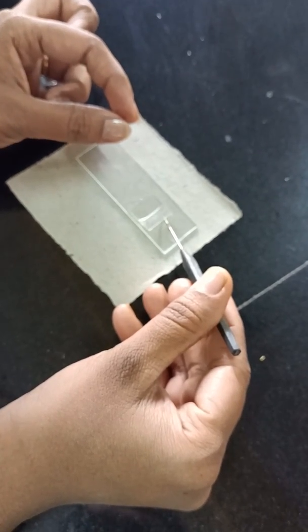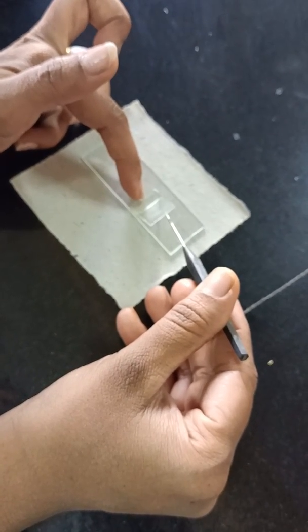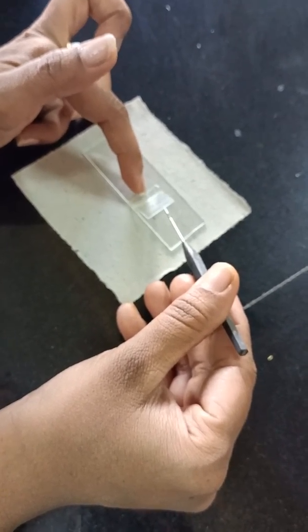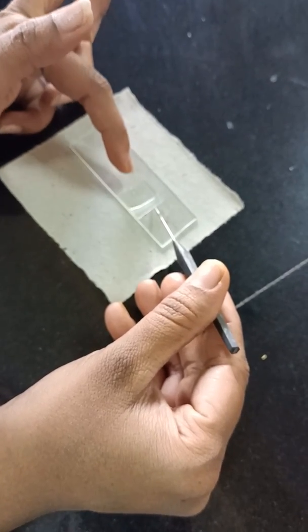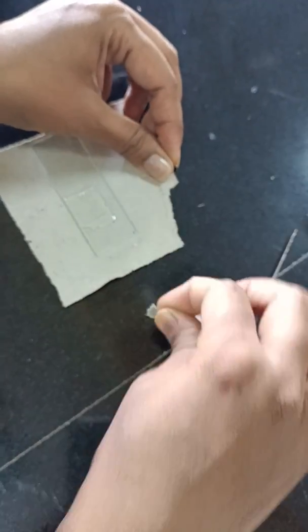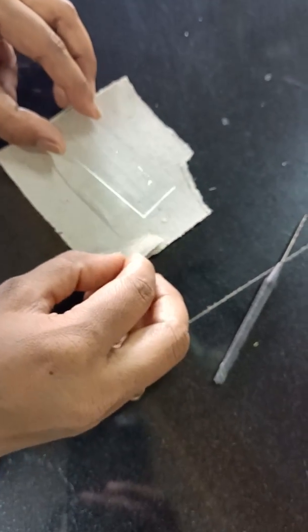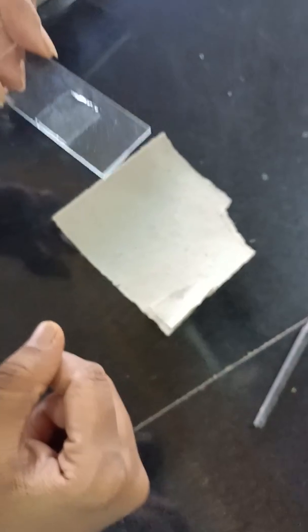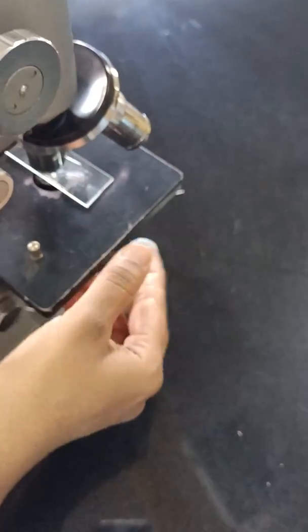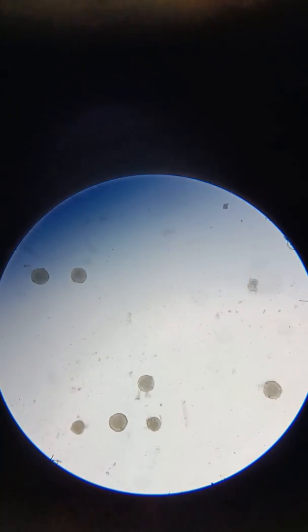Now see how I am putting the cover slip — I am just using a needle. At one end I am holding my finger and gradually releasing the cover slip so that air bubbles will not enter. Excess liquid you can blot, and then focus it under the compound microscope. Students, you could see around 7 pollen grains in this microscopic field — this is how they look.